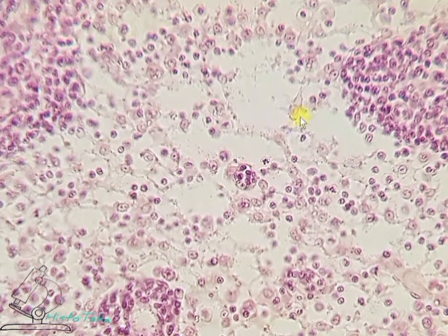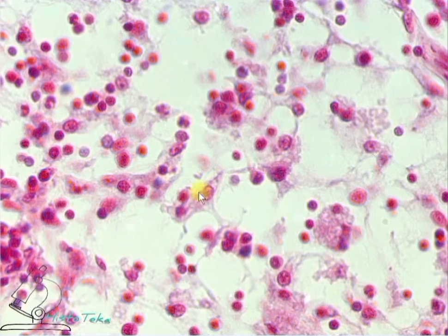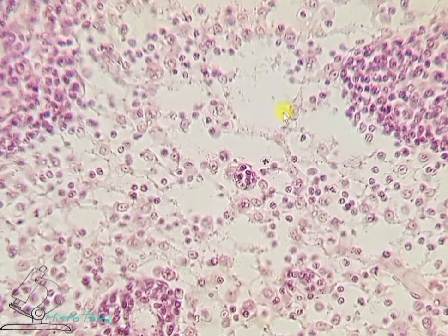The cells of reticular tissue are called reticular cells. Reticular cells are large, have a round basophilic colored nucleus, an eosinophilic cytoplasm, and processes that connect them to each other to form a network. Actually, hence the name of the tissue, because the reticulum is a network. Reticular cell. Another one, its nucleus and processes. And these are the reticular cells.